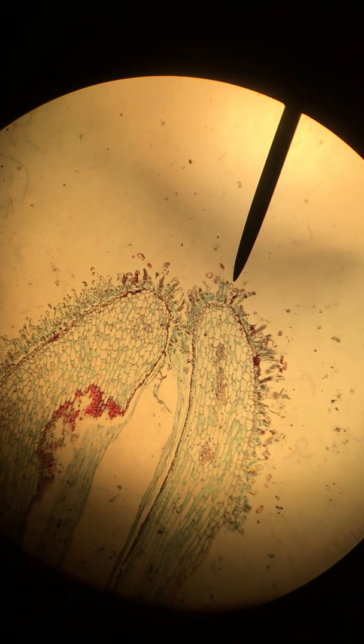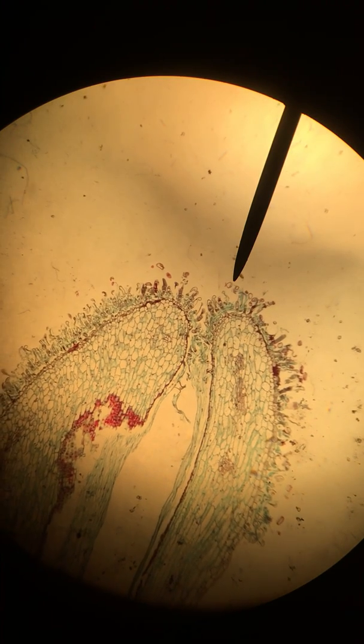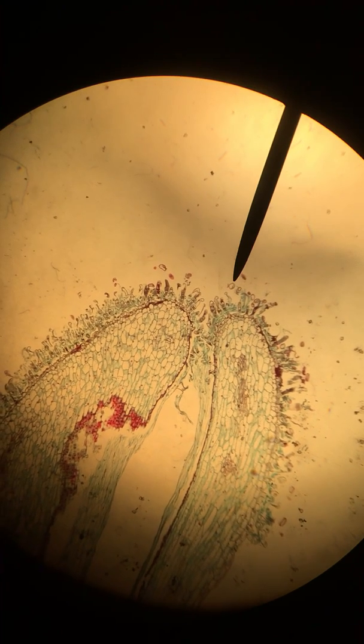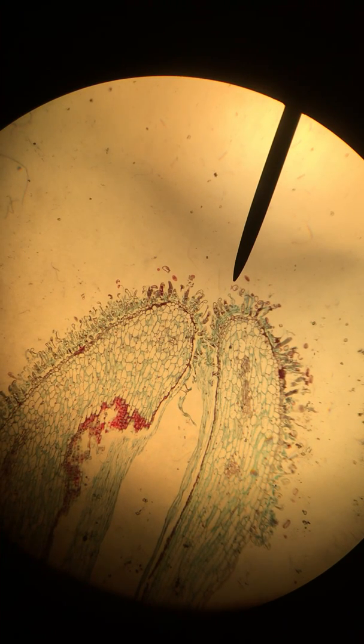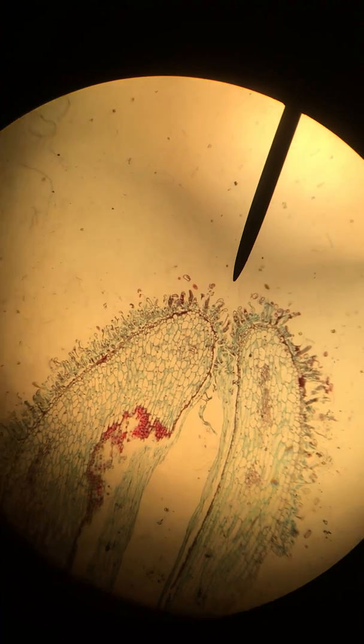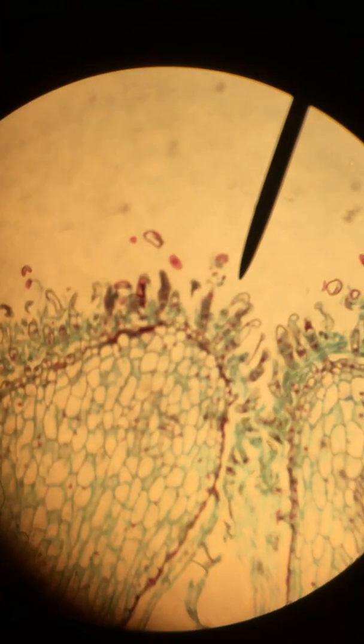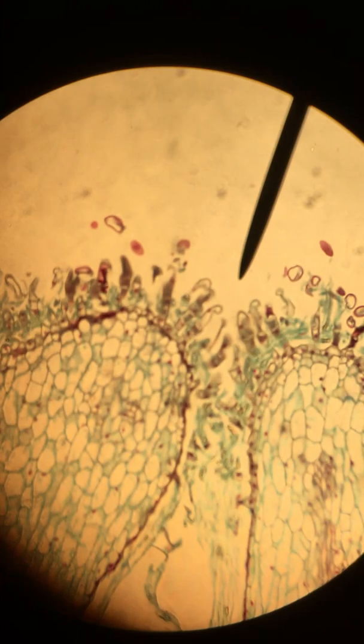We will increase our magnification here to see if we can see more detail at the tip, because I suspect that we will see that these are each individual pollen grains which have gathered at the stigma to allow for one of them to fertilize our egg and produce a new plant embryo. So let's increase that magnification and see what we can find. So here we are at the very tip. I'm going to find focus a little bit.